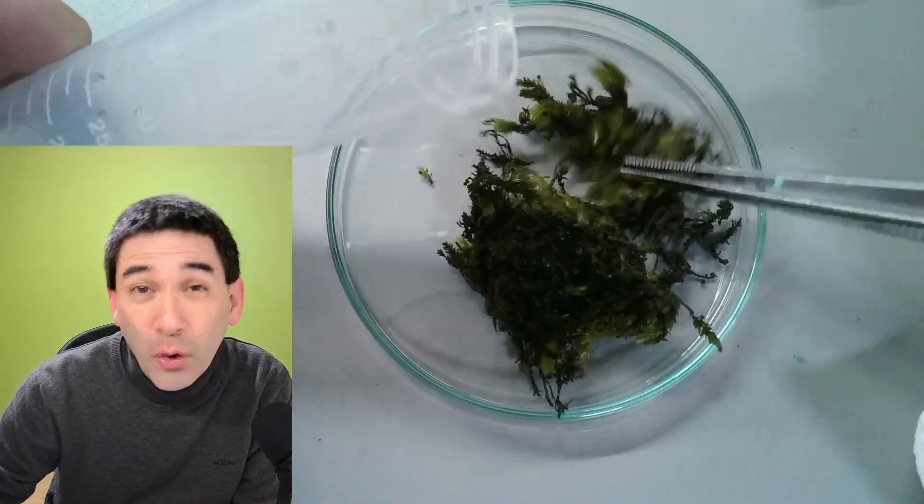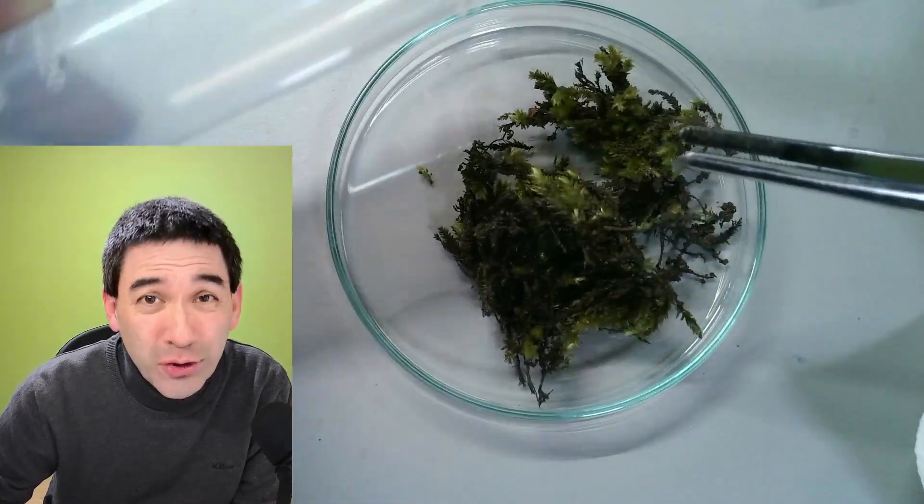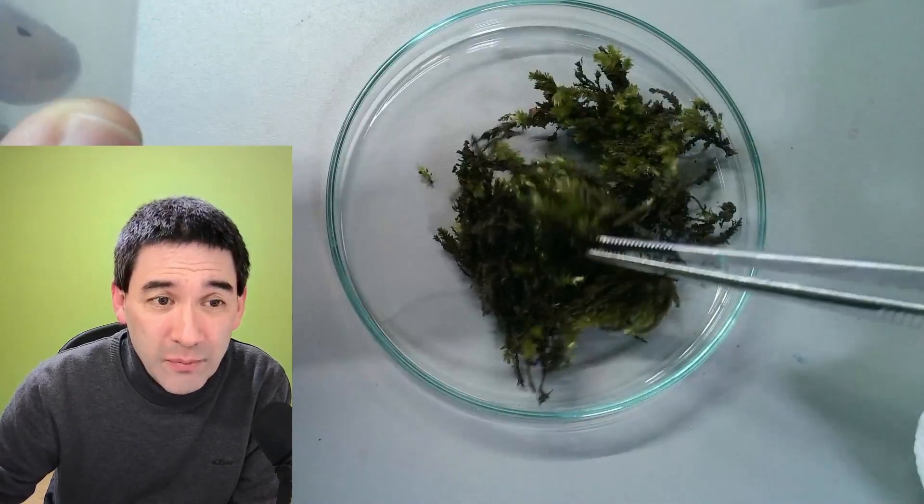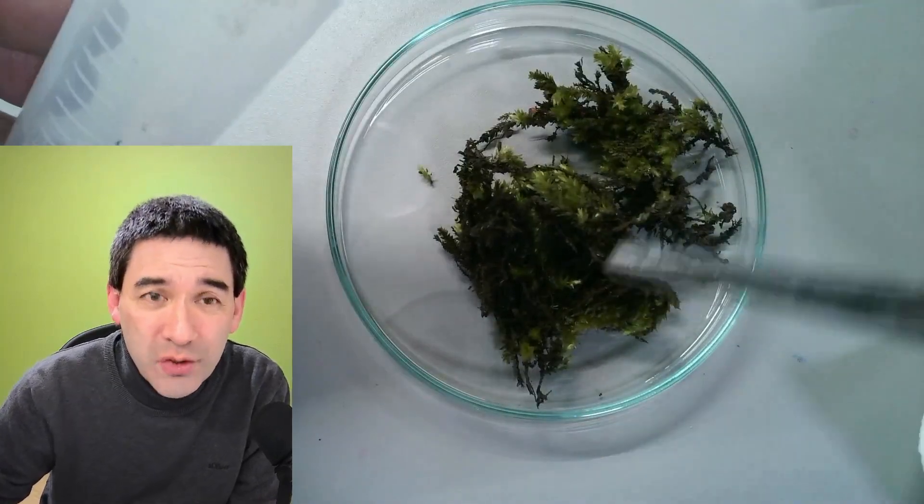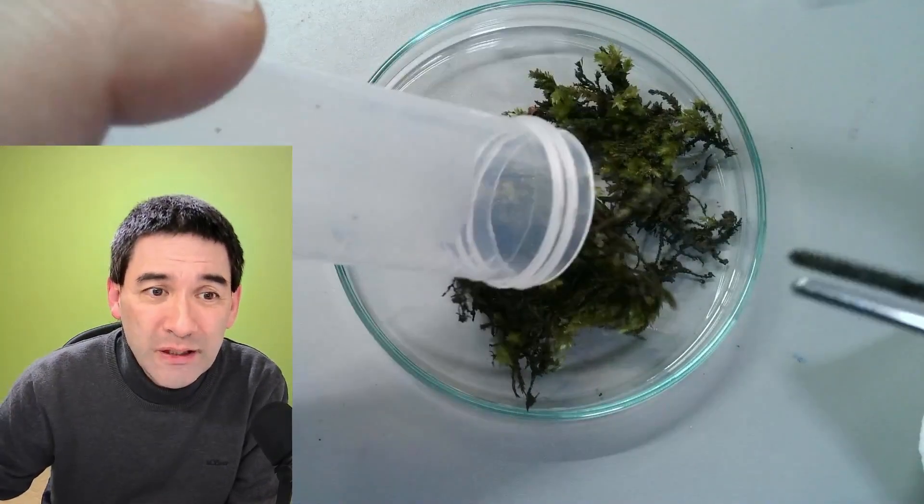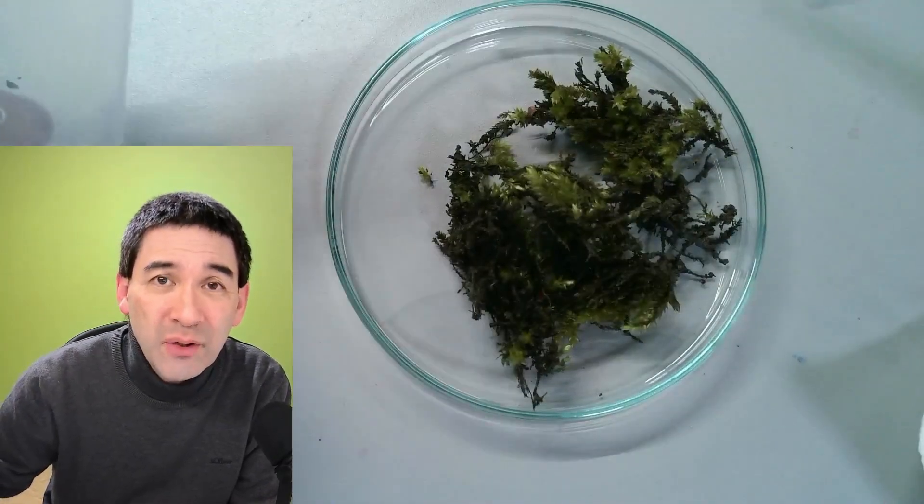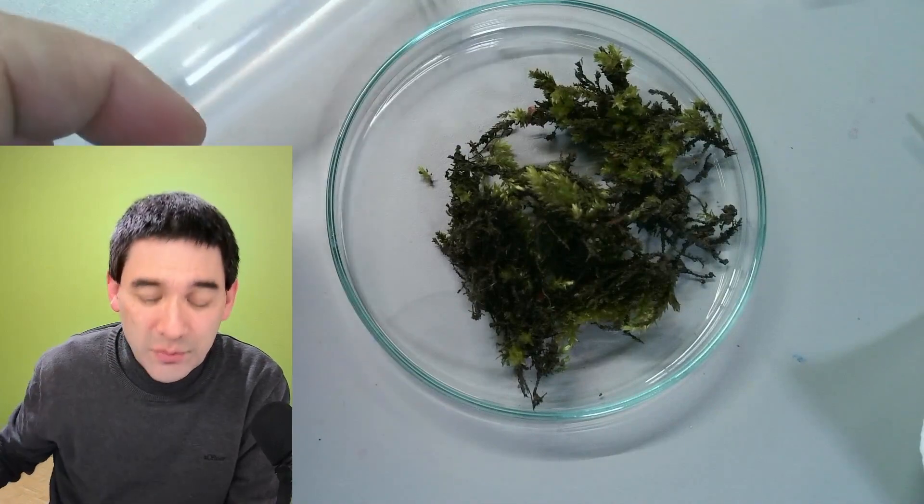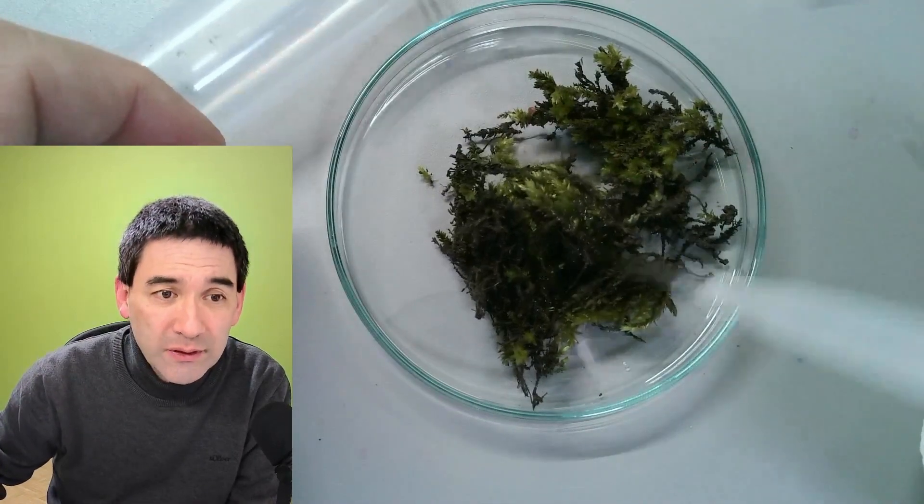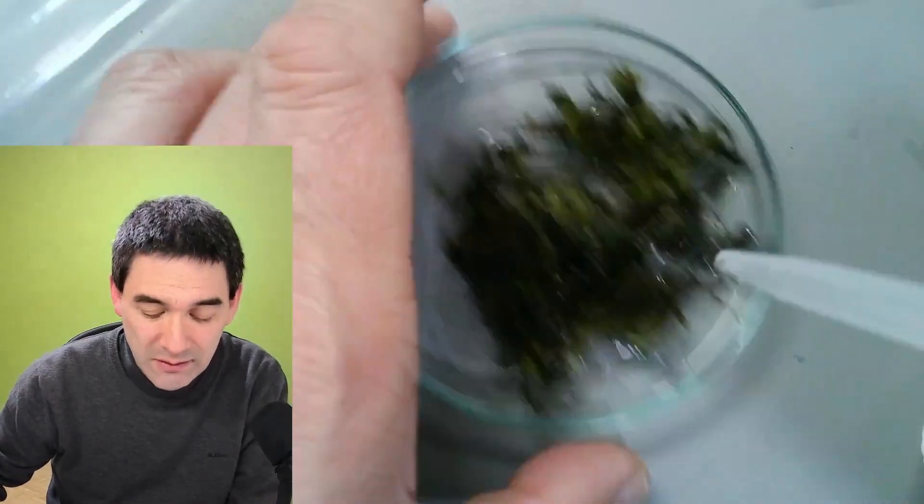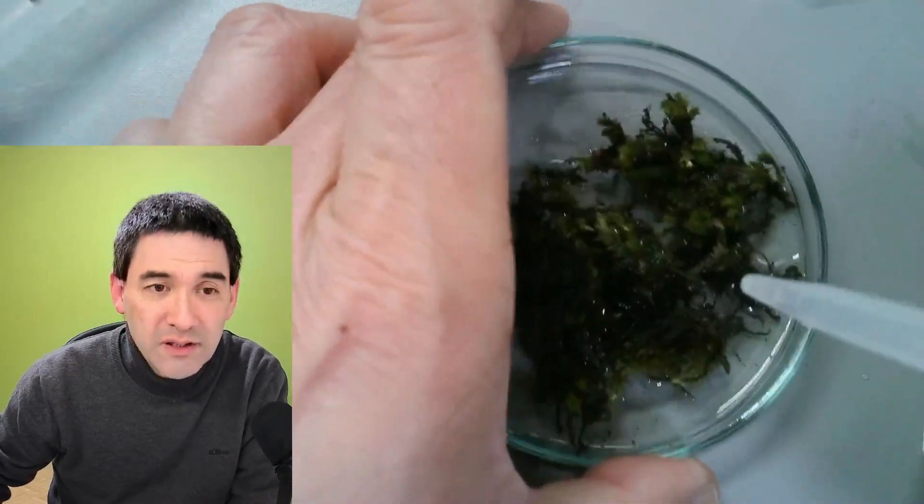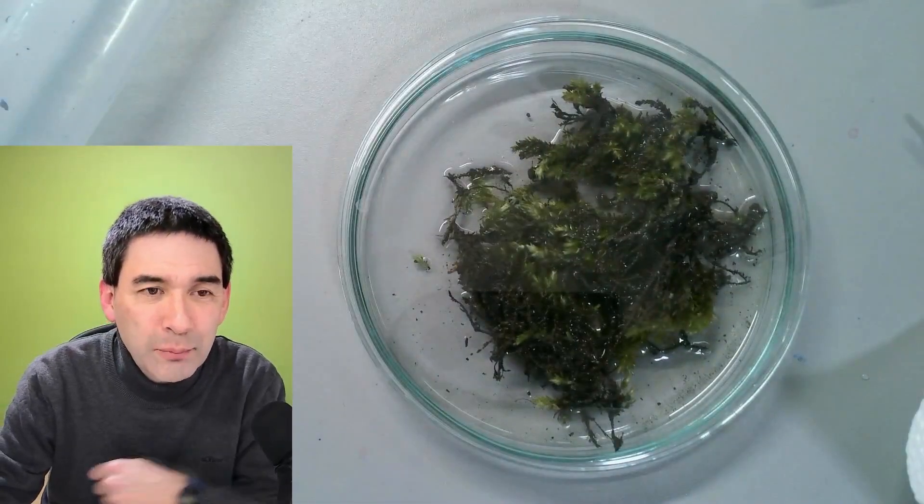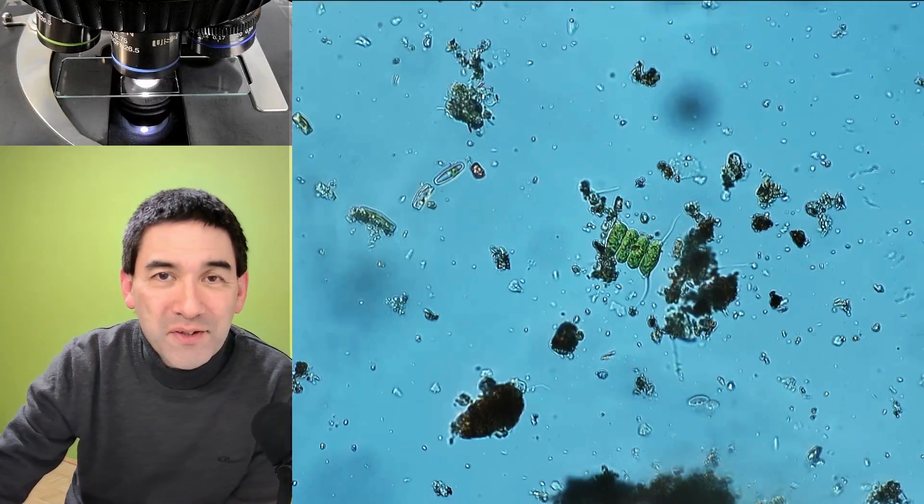And even though the moss sample was not completely dry I think it's a good idea to still add a little bit of water and give it a few hours. So let's do that, let's add a little bit of water to the moss and let's simply be patient now. Lid goes on top to prevent evaporation. Well I was not patient enough.